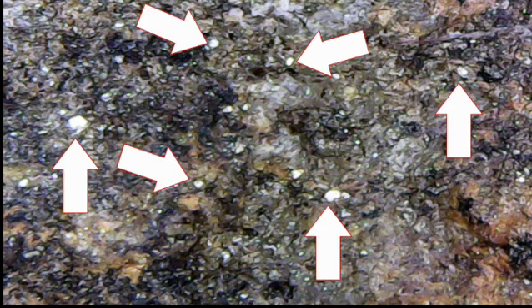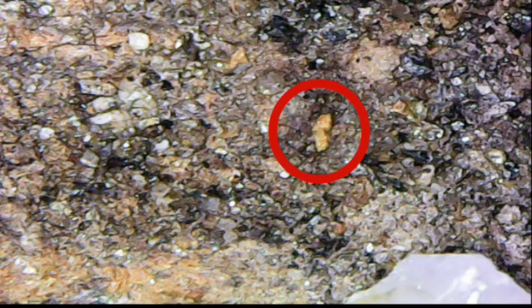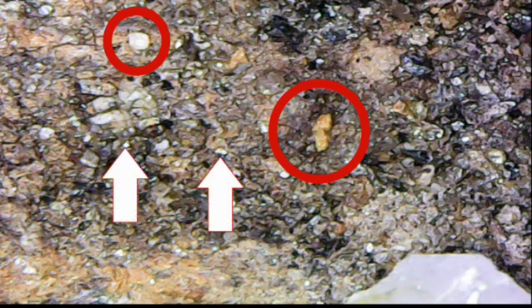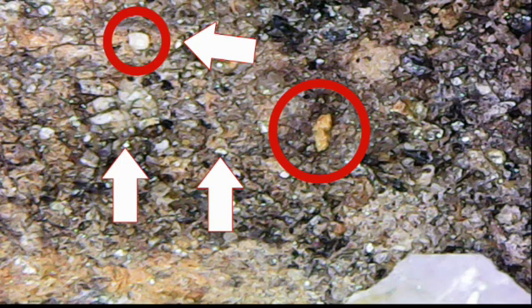I didn't bother putting an arrow on all of them. I'm going to let you look at this one — tell me what you think those are that are circled in red. They're both garbage. The ones circled in red: one's a sulfide, and one's just a piece of quartz. The arrows indicate the gold, or at least that which I perceive to be gold.